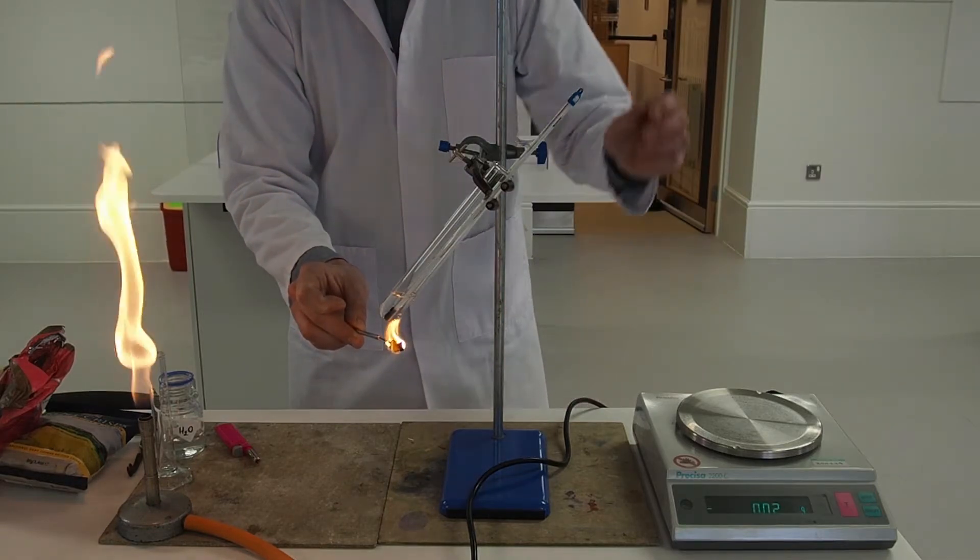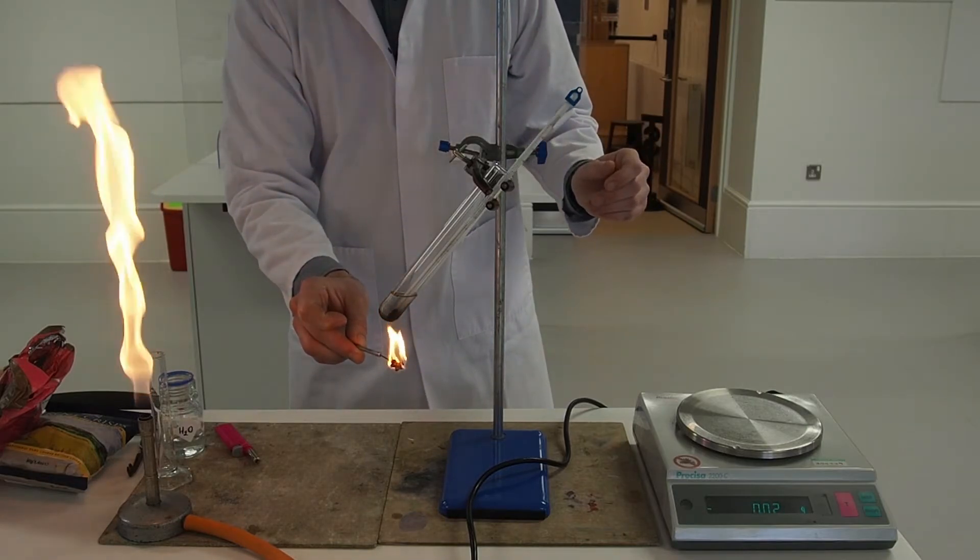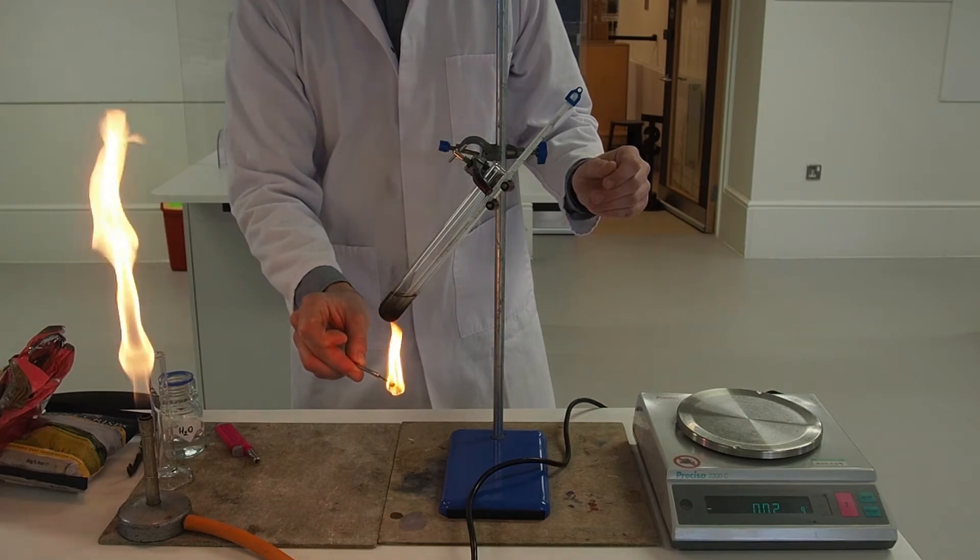And we just stir from time to time to make sure the water is being evenly heated. The soot is due to incomplete combustion of the food substance.